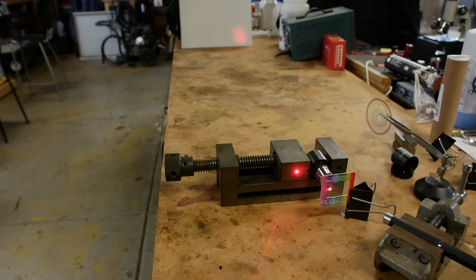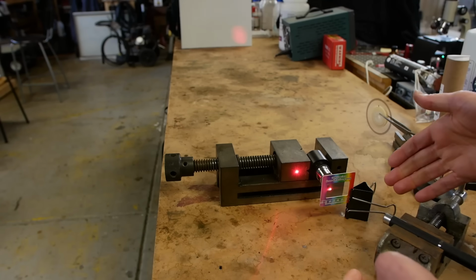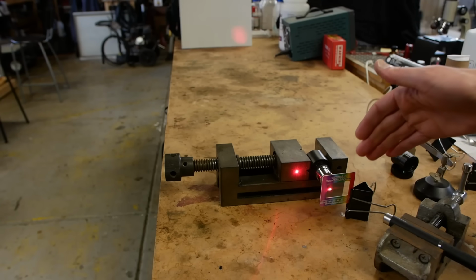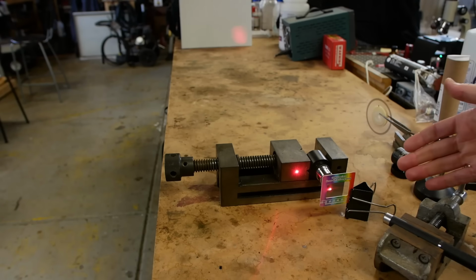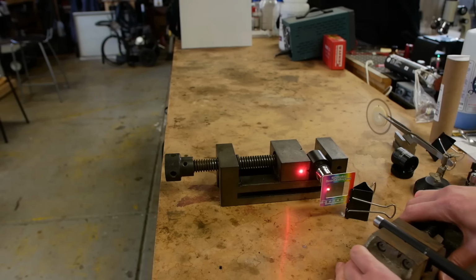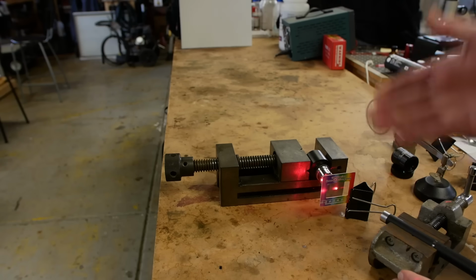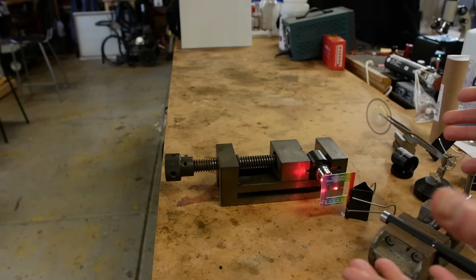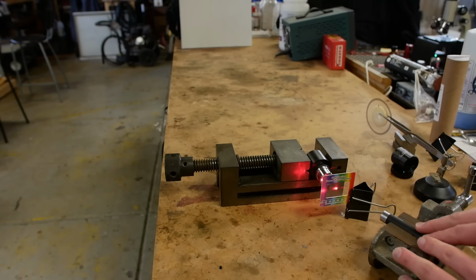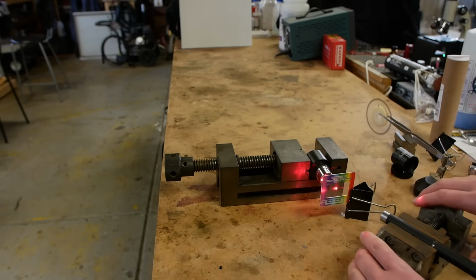So imagine it this way. Instead of just a flat grating here, imagine that this were a checkerboard, a tiny little checkerboard, and all the white squares are 1,000 lines per millimeter, and all the black squares are 600 lines per millimeter. So what's going to happen is when we rotate through these angles, there'll be one angle at which all of the black squares are activated. I mean, they're diffracting light and sending it into our optical system. So we'll end up with all of the black squares being illuminated over there.